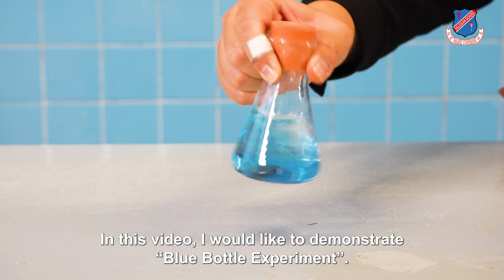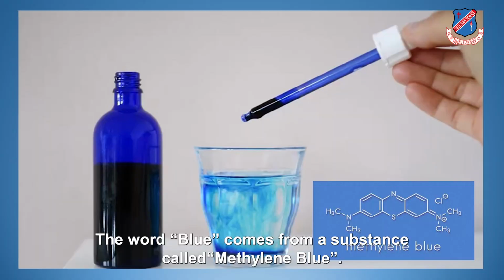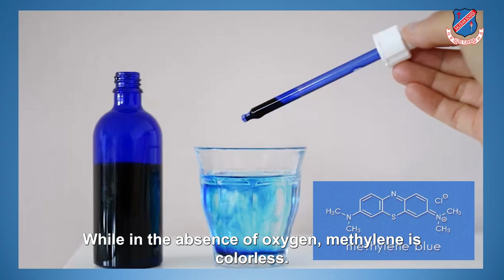In this video, I would like to demonstrate the blue bottle experiment. The word blue comes from a substance called methylene blue. This is an indicator which tests for the presence of oxygen. If there is oxygen, methylene blue is blue in color, while in the absence of oxygen, methylene blue is colorless.